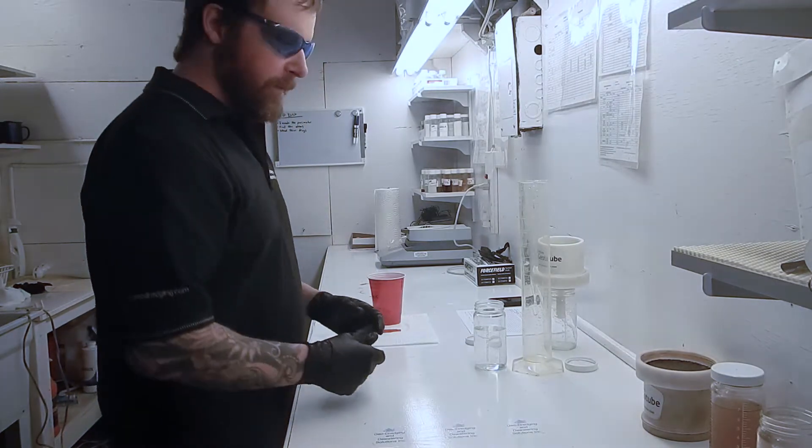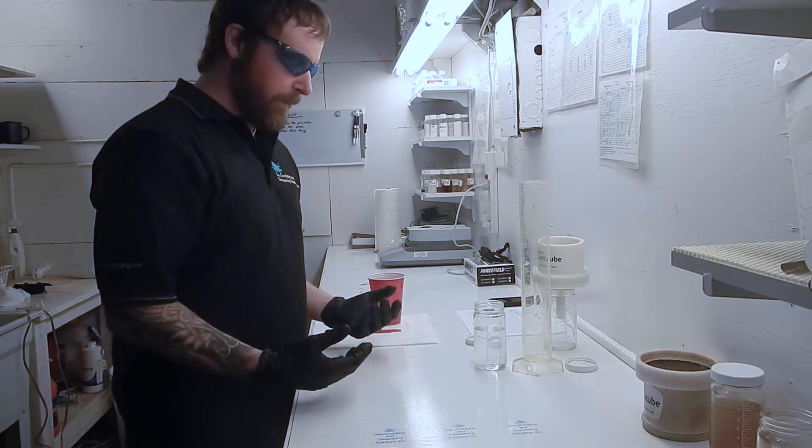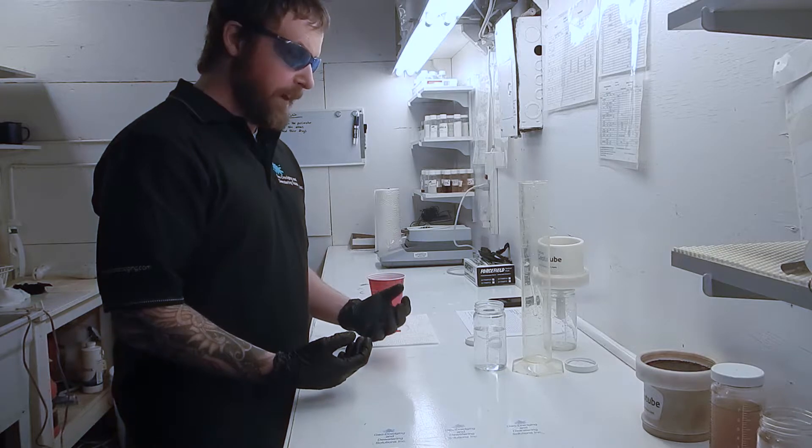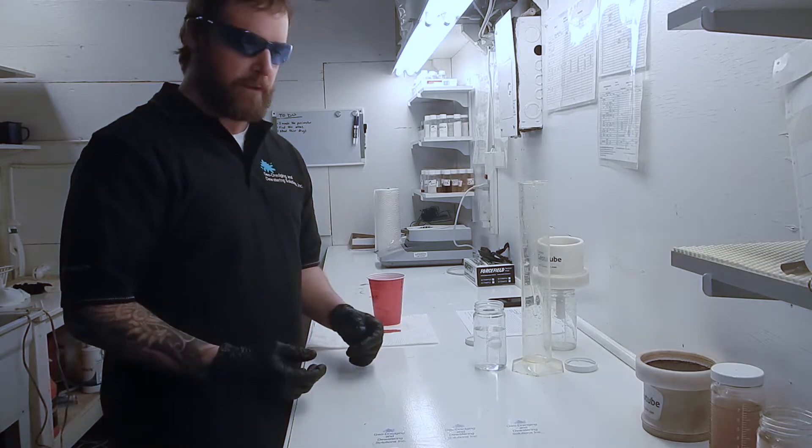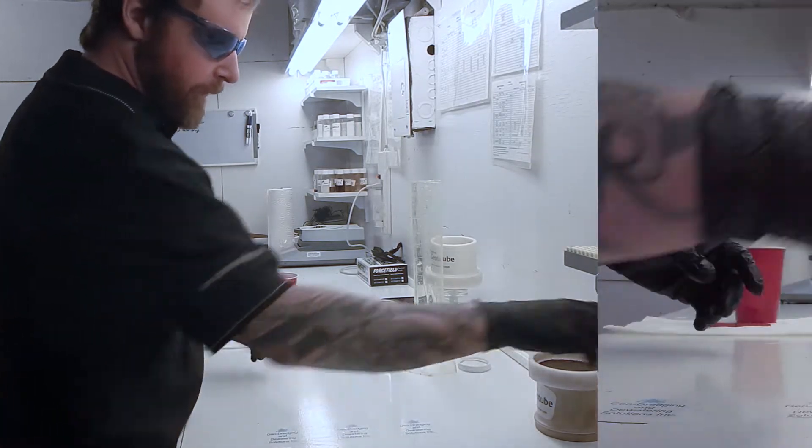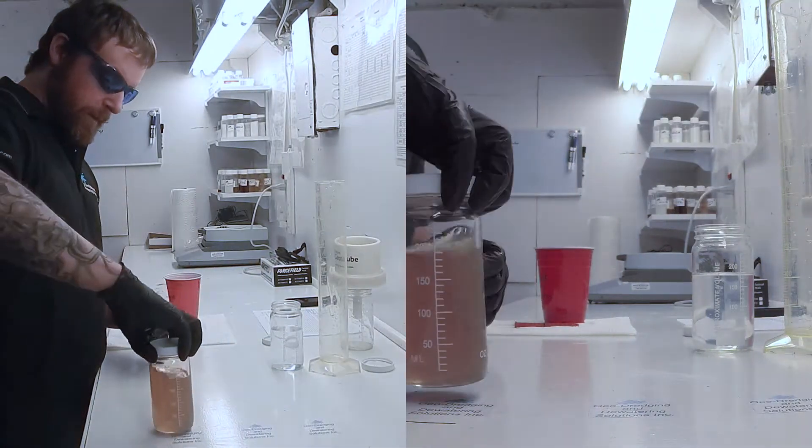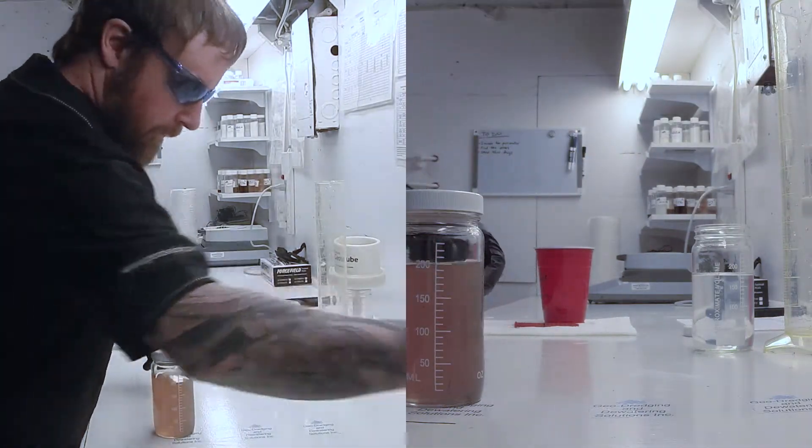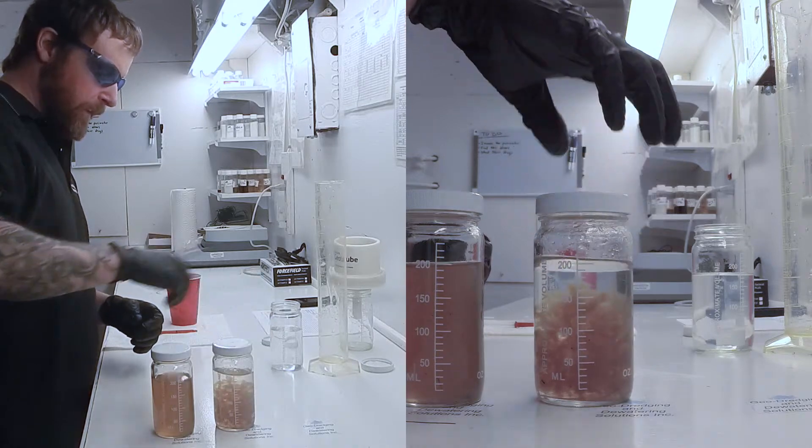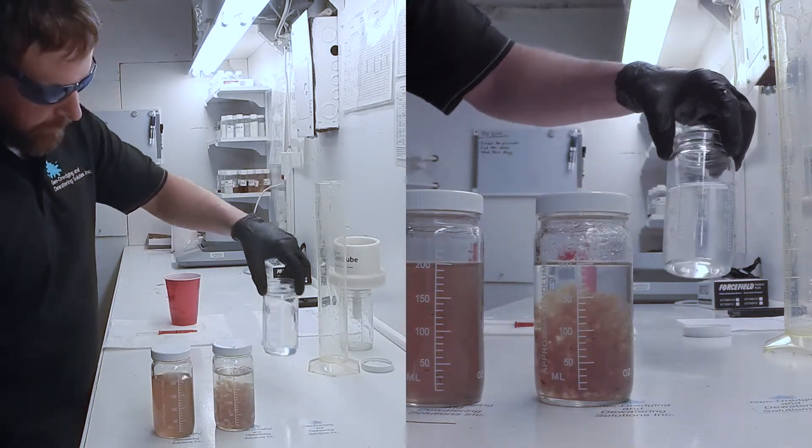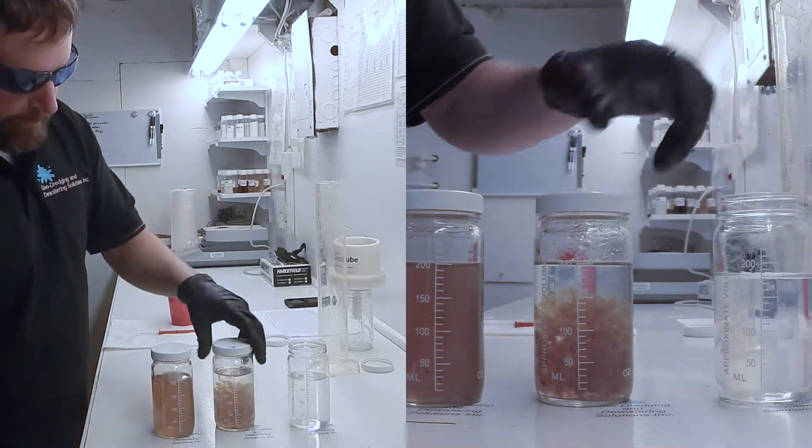Now the purpose of our RDT test is to help us determine which polymers will work best to dewater whatever type of material we're dealing with. And there you have it. So we went from our raw material to our conditioned flocculated material and we collected our nice clean clear filtrate.